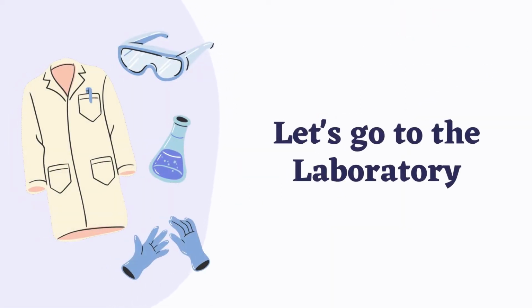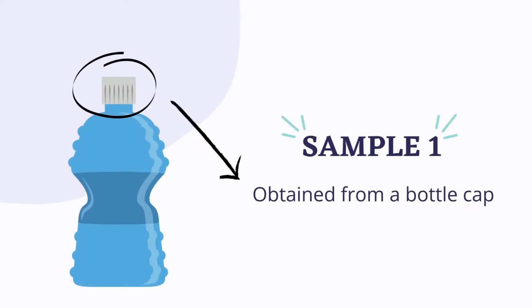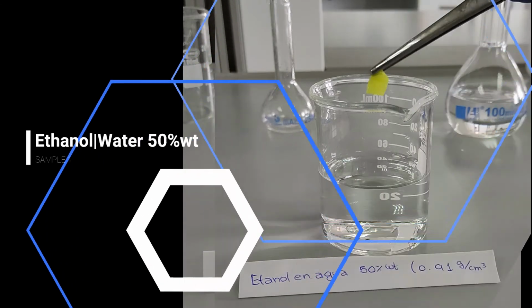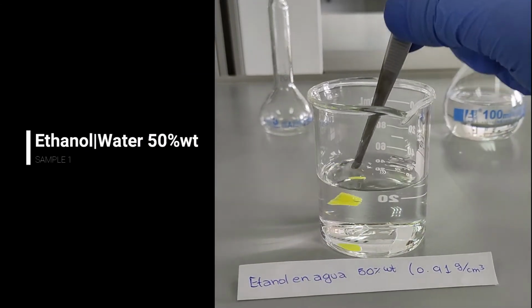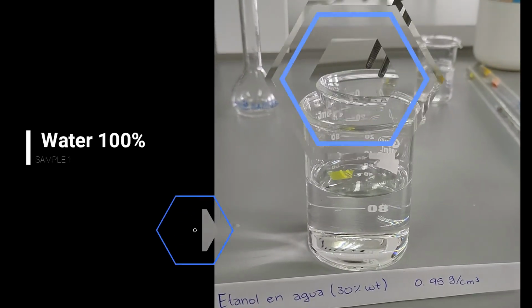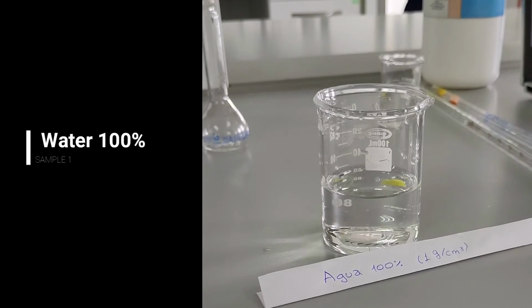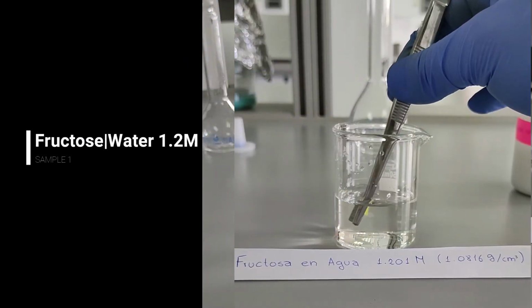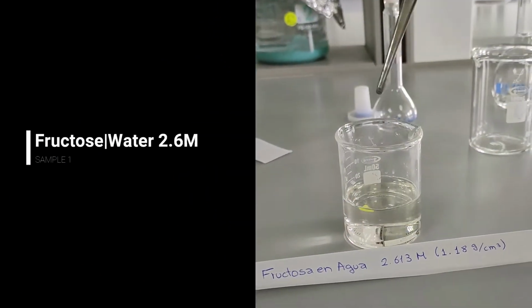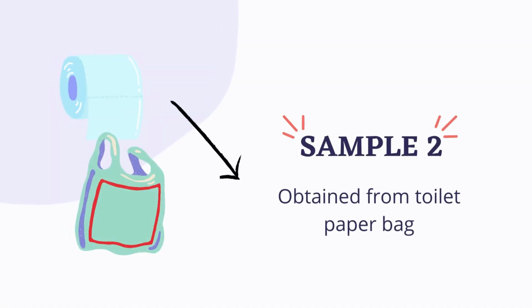Now let's go to the laboratory test. The first unknown sample, named sample 1, was obtained from a bottle cap. Second sample, called sample 2, was obtained from a toilet paper packaging.